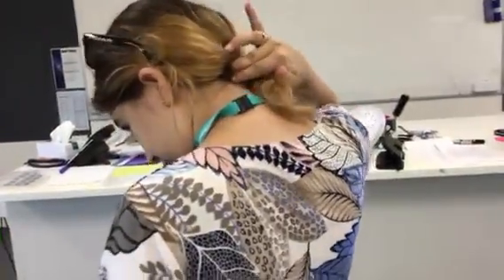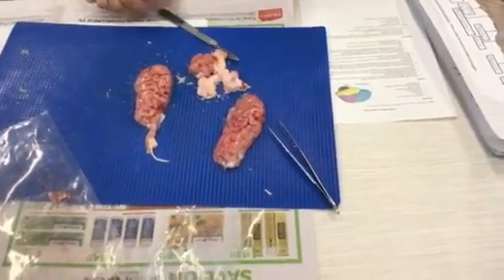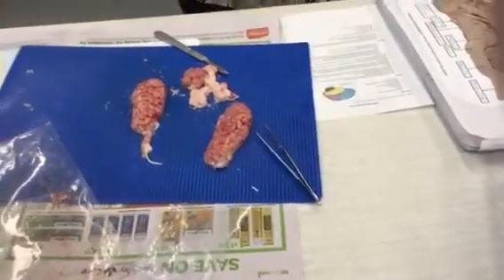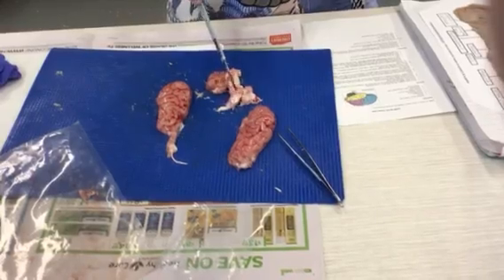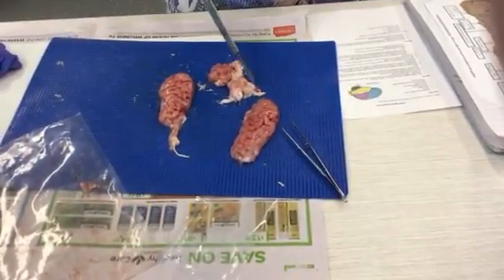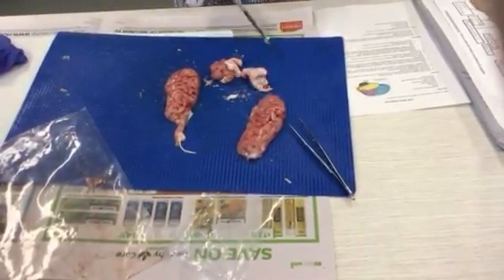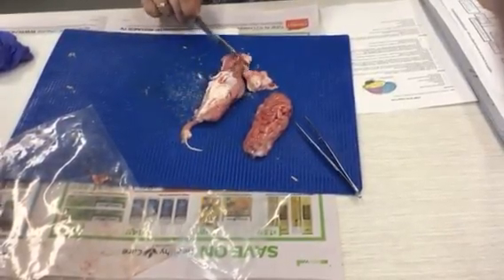If you feel it, it's pretty strong, which is good, because it's what transmits everything we feel in our bodies with our hands, for example the smooth desk, to our brains. We noticed that these little round bulby pinkish bits is called the pons, and above that is the thalamus and the hypothalamus. I think that's everything. When we flip it over, we can see the underside.